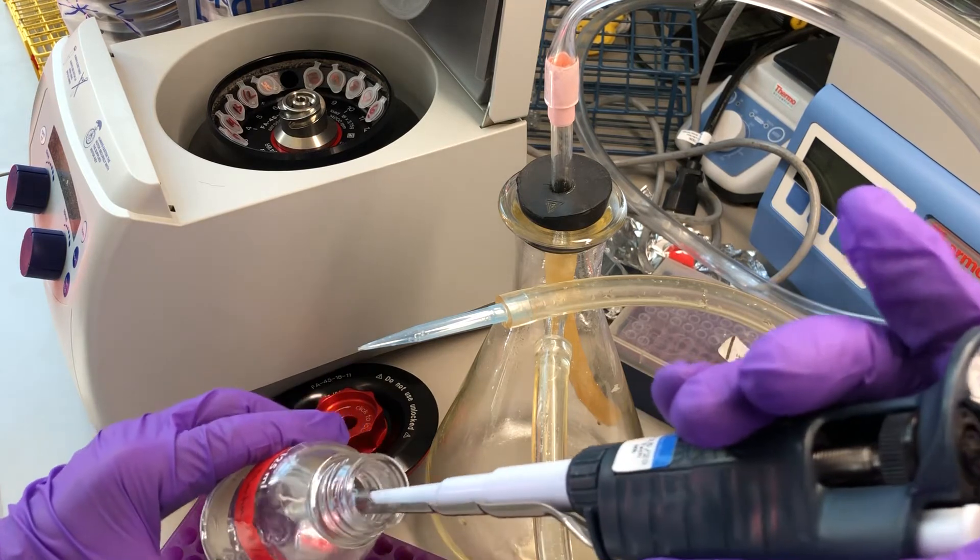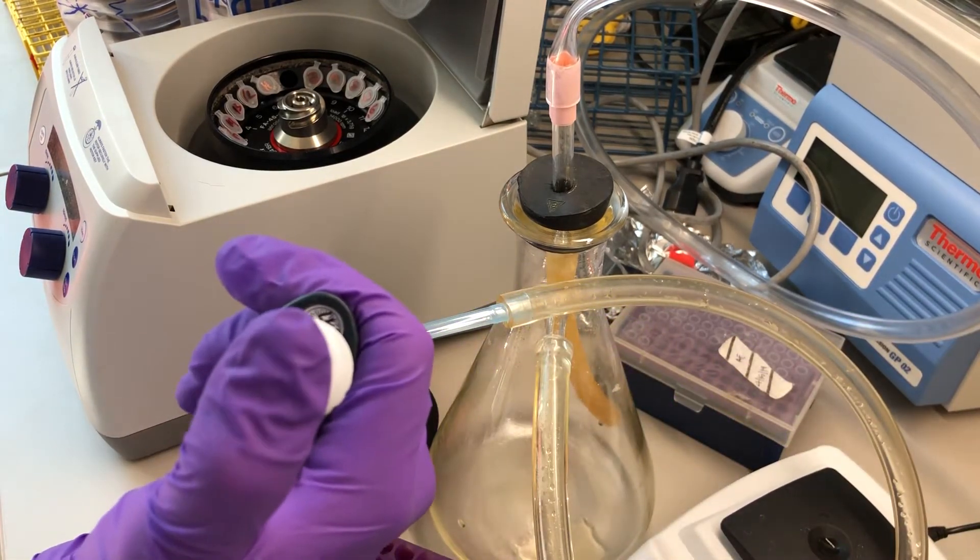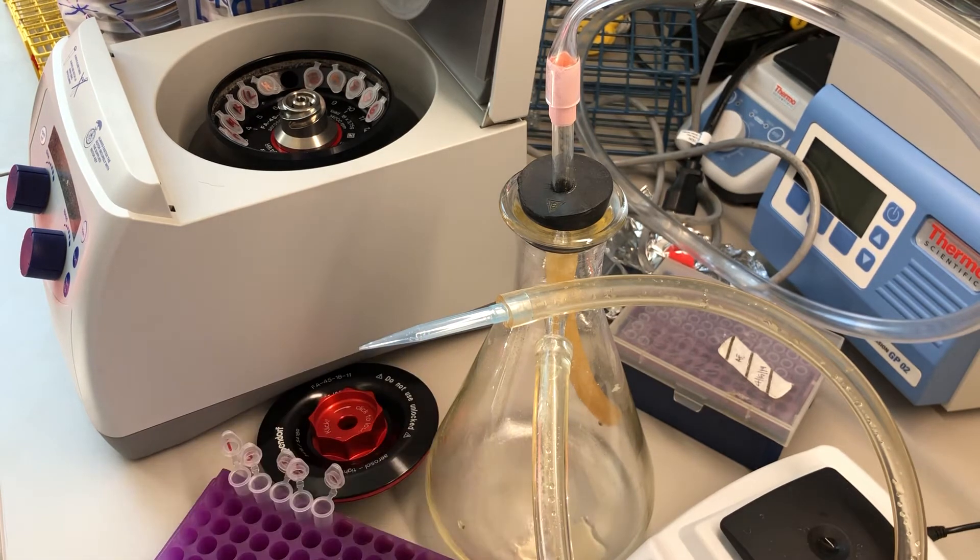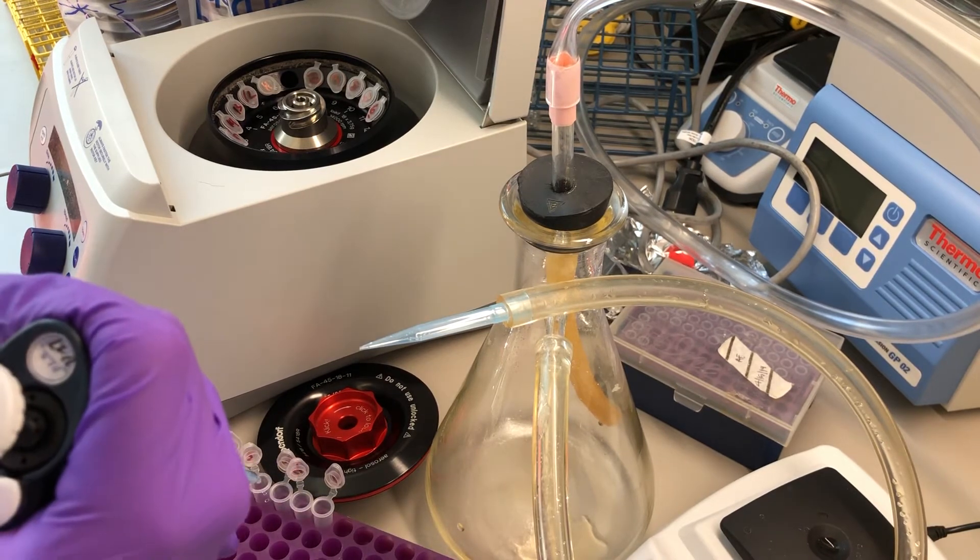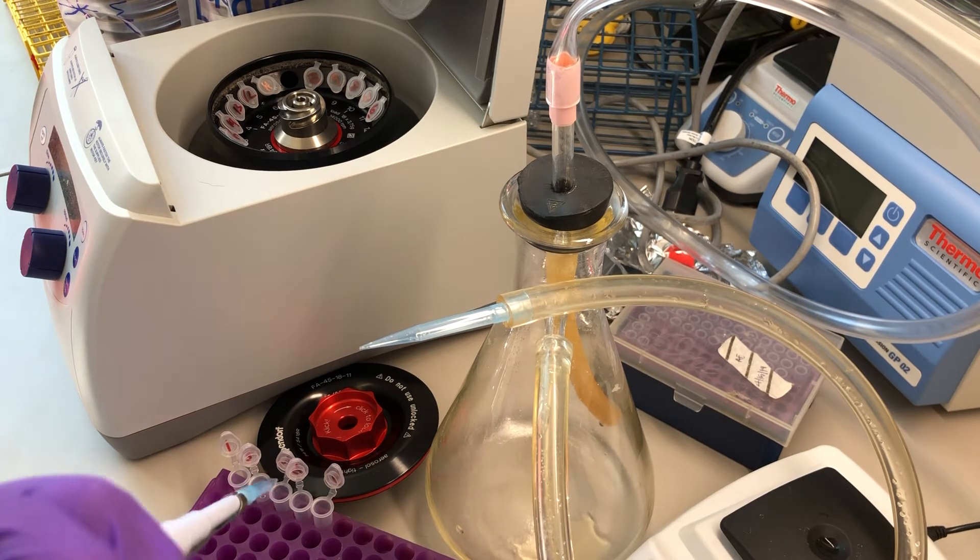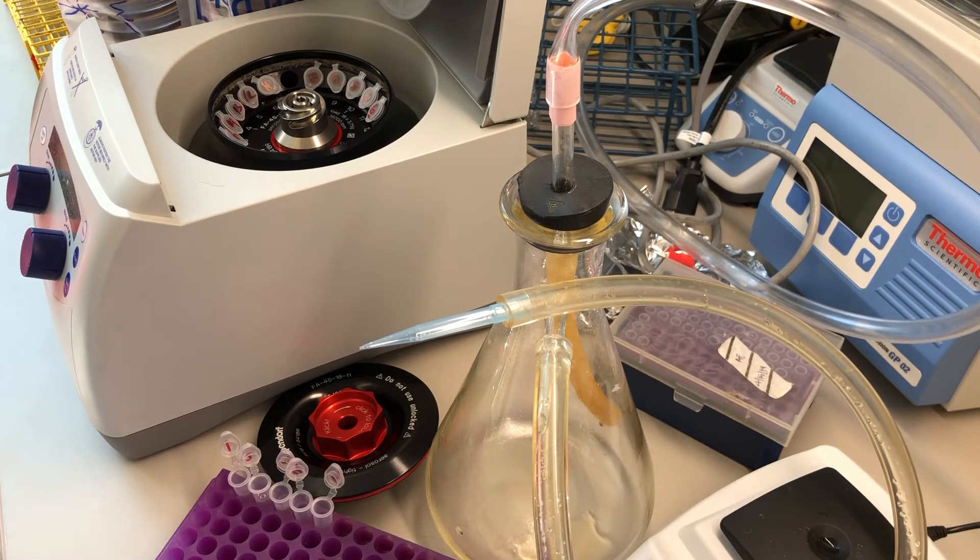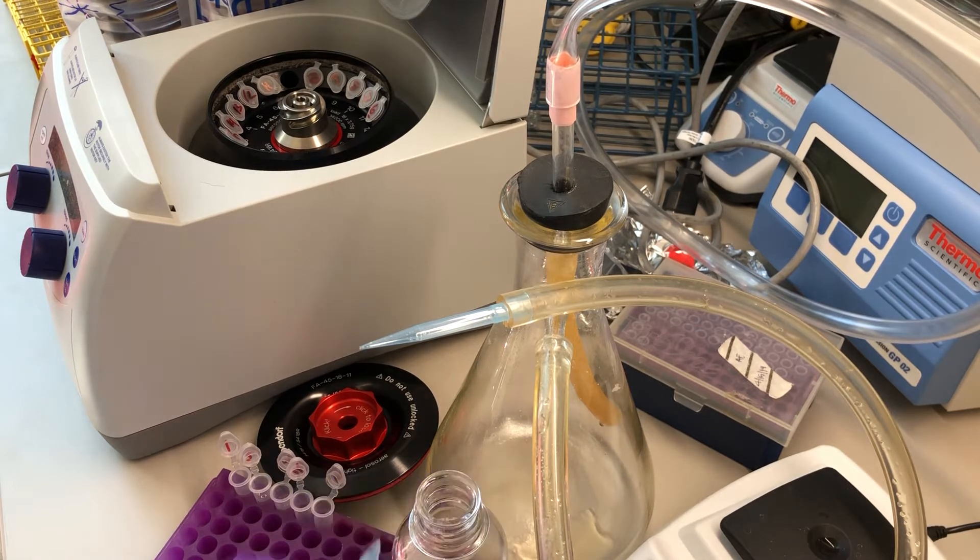So I'm pipetting one milliliter and I'm going to make sure I don't touch the tubes as I deliver this volume. That way I can confidently go back with the same tip. Saves time if you don't have to change tips. If you do touch the tubes or you feel uncomfortable using the same tip, just go ahead and change the tips. But this is a time saver if I don't have to change the tips.